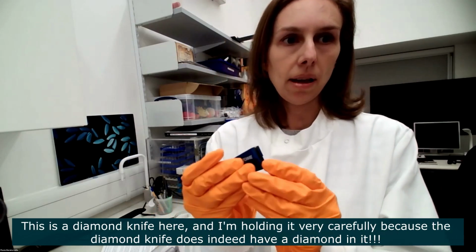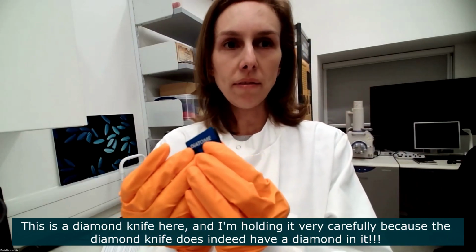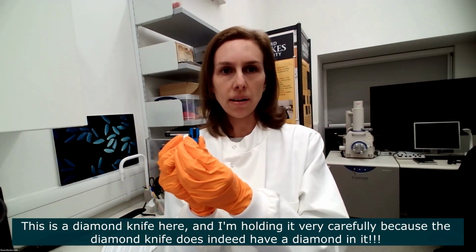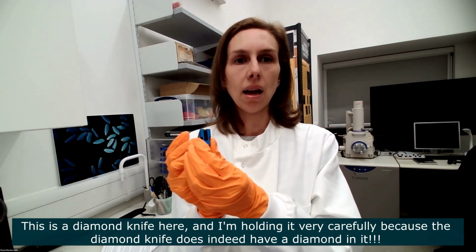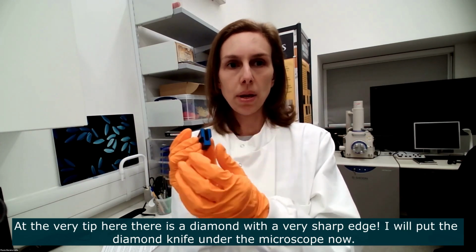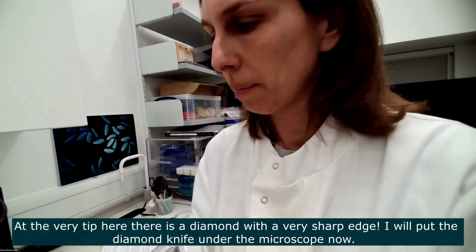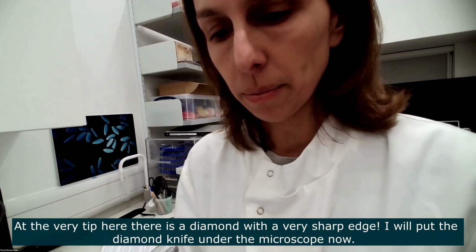And that's a diamond knife here. And I'm holding it very carefully, because the diamond knife is called a diamond knife for a reason: it has a diamond at the very tip here. I'm going to show you the diamond. It has a very sharp diamond. Okay, so I'll put the diamond knife under the microscope now.